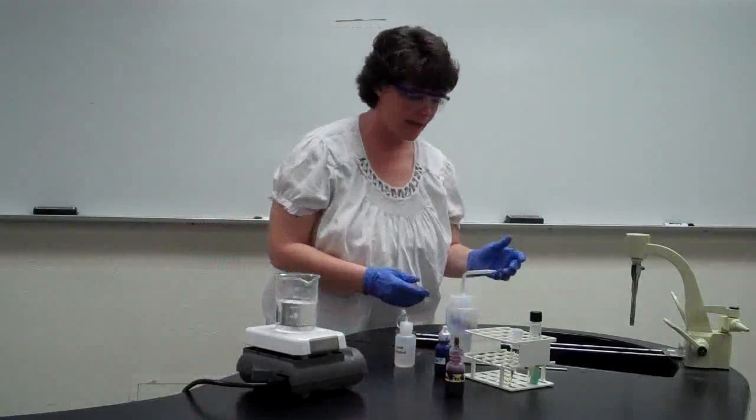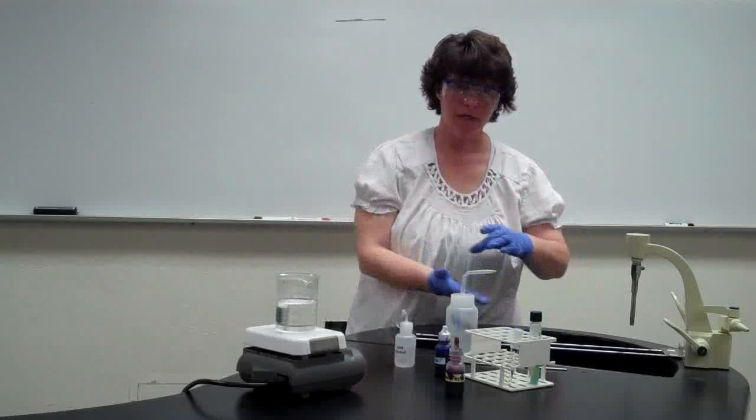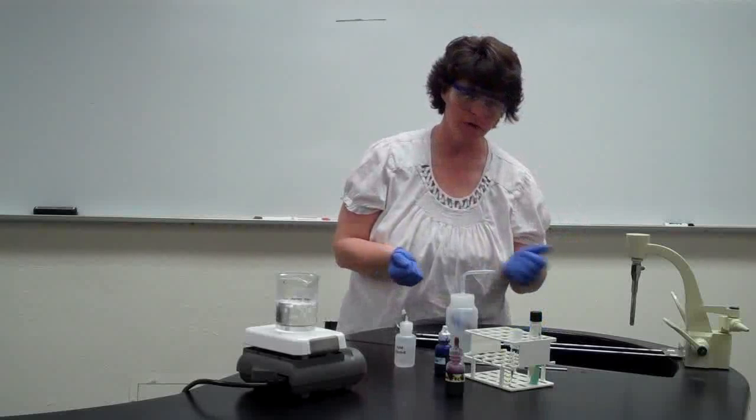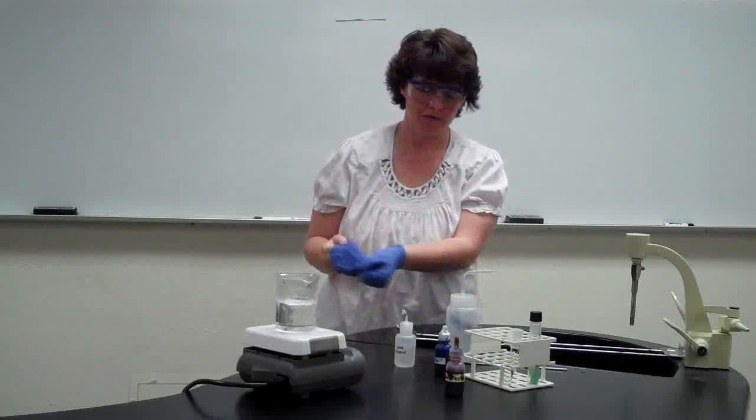And now that we're done rinsing, we can grab a paper towel, which I seem to not have, so pretend I had a paper towel. You would blot the back like we did before, and gently blot the front, but don't wipe your smear off. You don't want to waste your last 10 minutes of work. So that's the acid-fast stain. The next stain that you're going to learn is going to be the endospore stain.